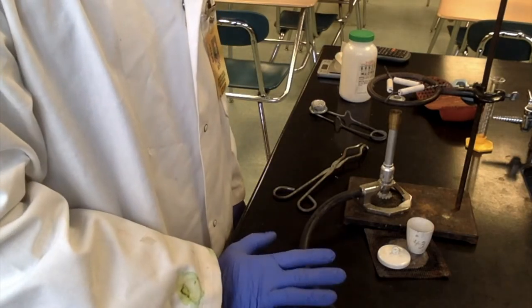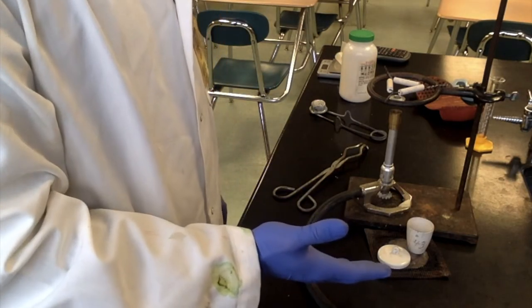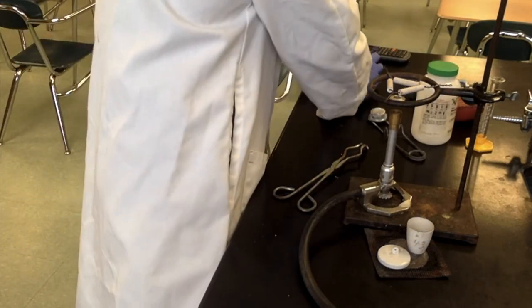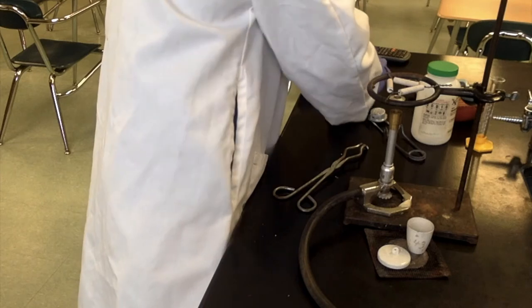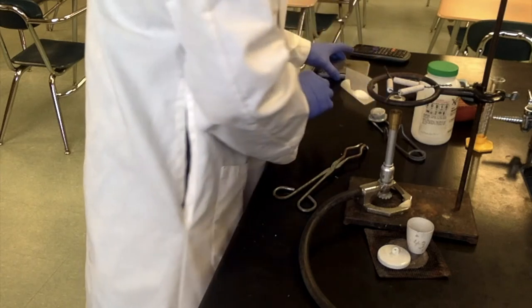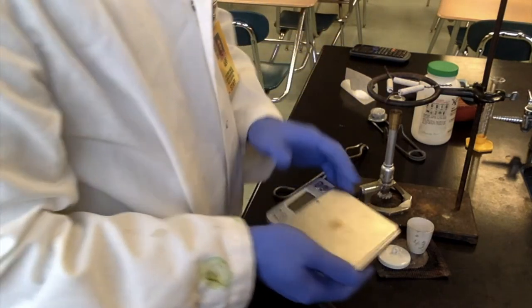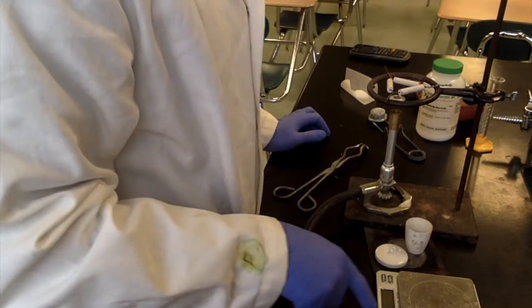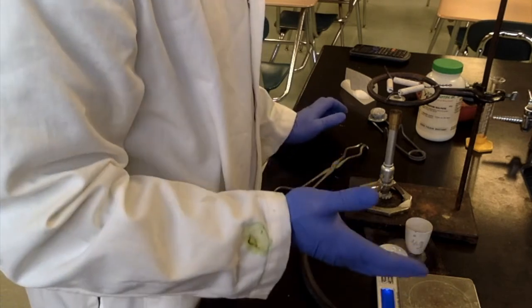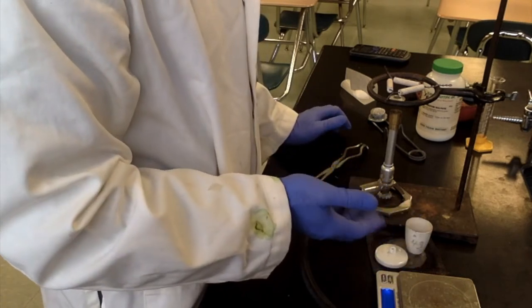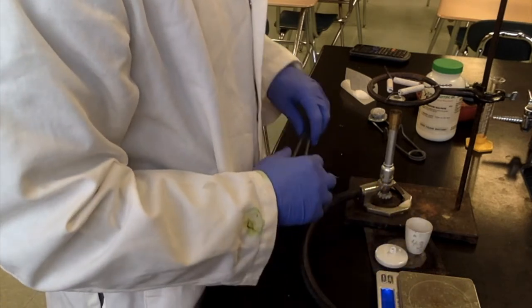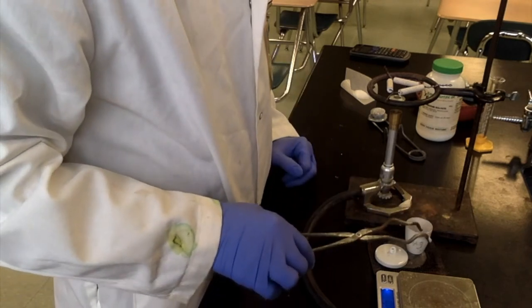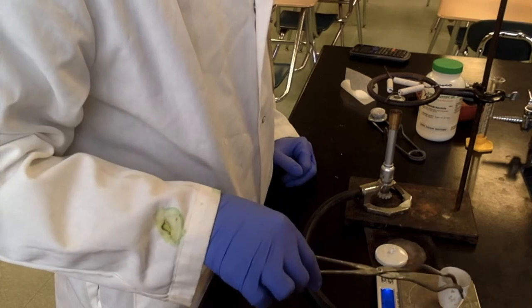Okay. It's been cooling for about 10 minutes, so we'll get a weight on the crucible and cover. Move the magnesium sulfate out of the way, and we'll turn this on. Now it's really important, even though this is cooled down, not to touch it, because even though I'm wearing gloves, you can get all kinds of crud back on here. But we're going to move that over here.